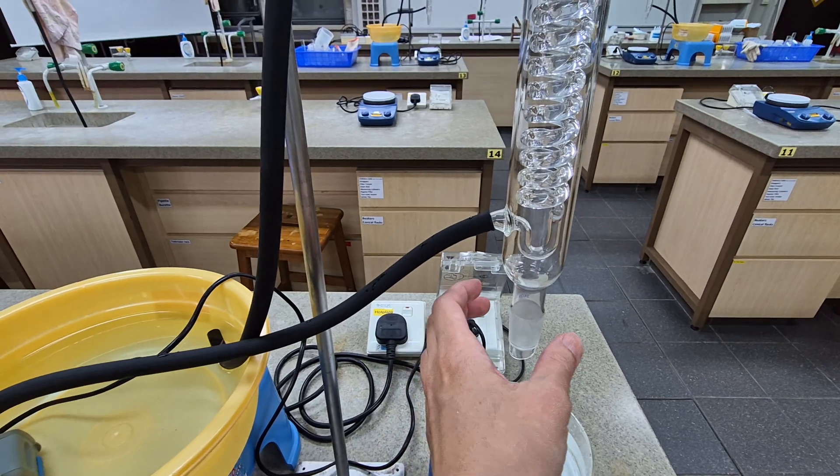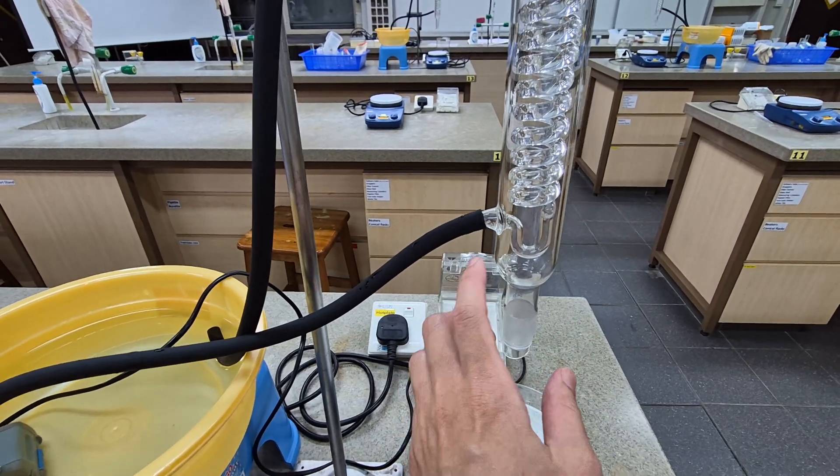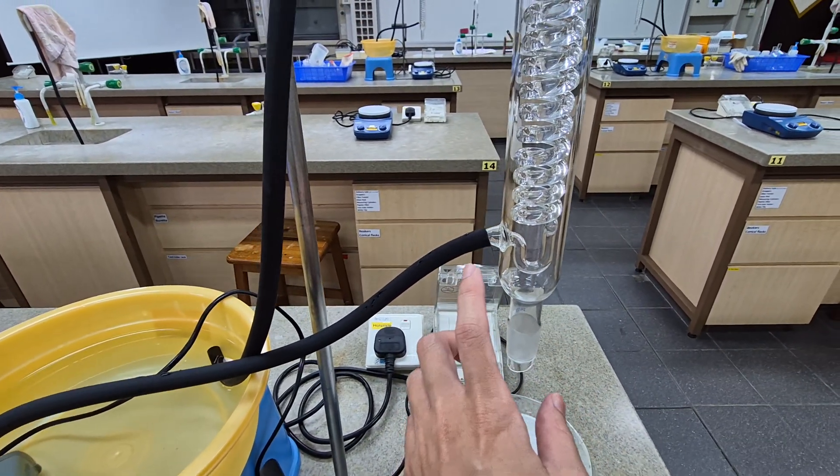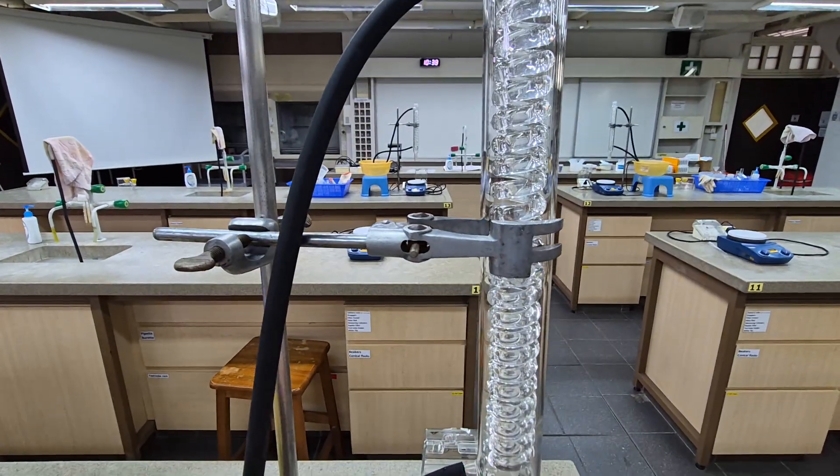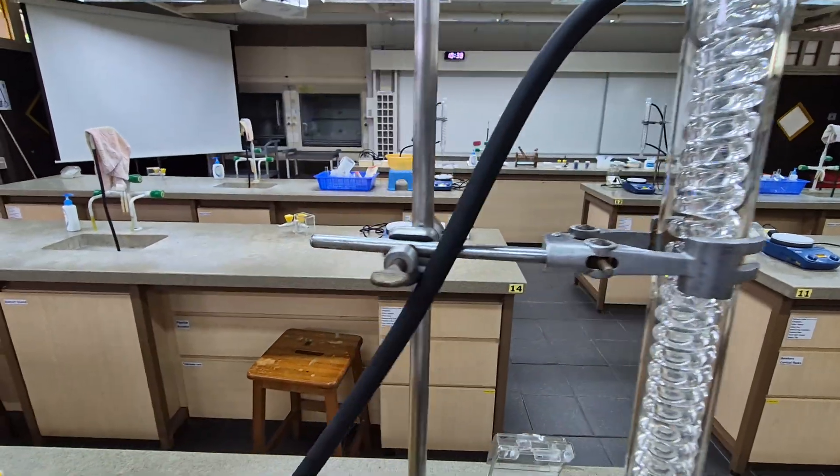After that, the water will flow from here and then exit over here. If I switch on the pump, you'll be able to see.